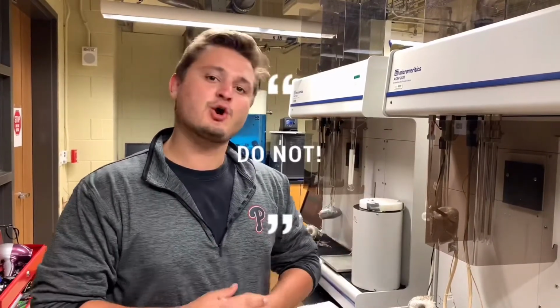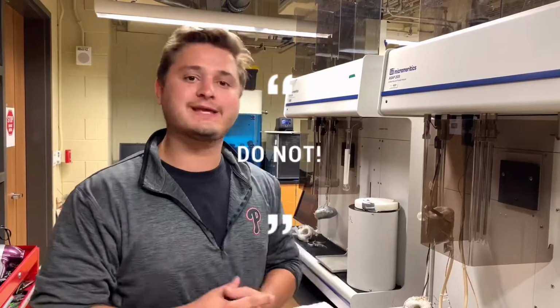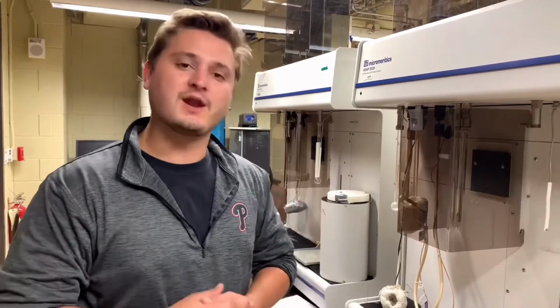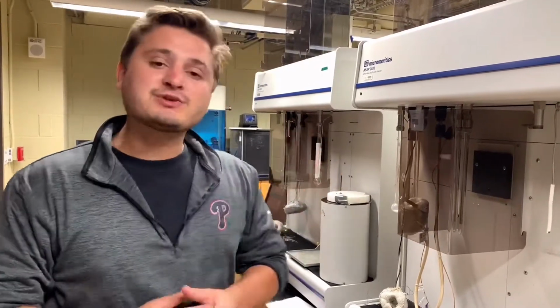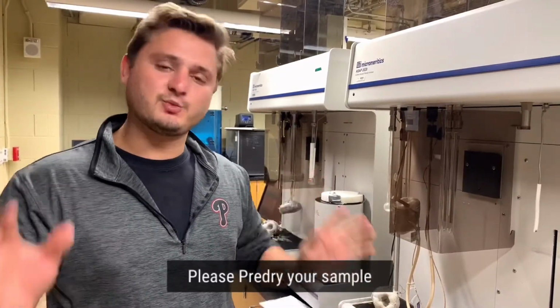Okay, so now that the degas is ongoing and almost finished, I wanted to talk about the absolute do nots, what you should not do of the activation or degas process. This also involves me saying what you should do before running the sample. What you absolutely should do to preserve the life of the instrument is pre-dry your sample. This is required within the Zhou Group.